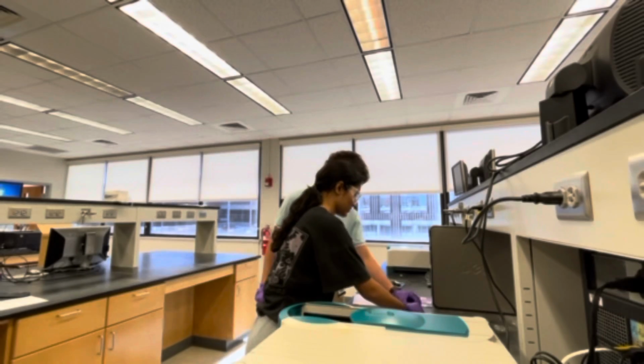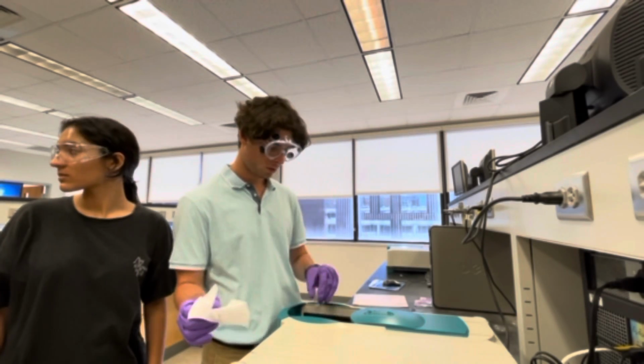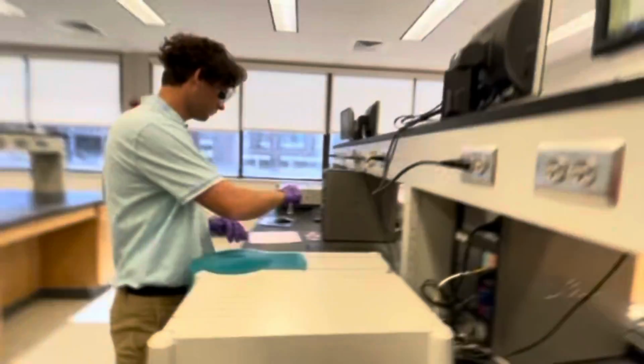Though it is not shown in this video, this group did clean their work area. Please remember to always clean your work area to ensure a safe environment for your group as well as all the other people that are participating in the laboratory.